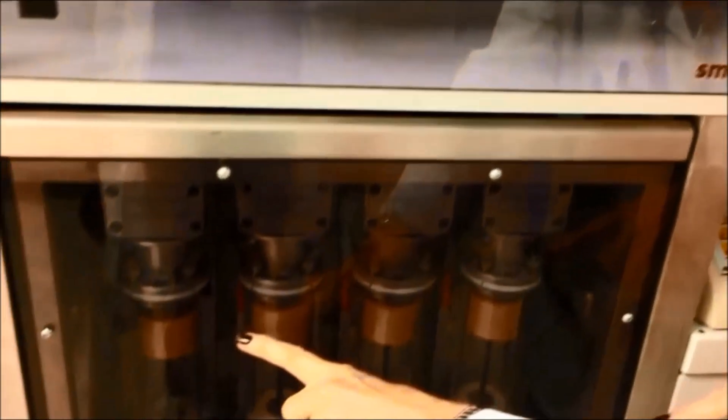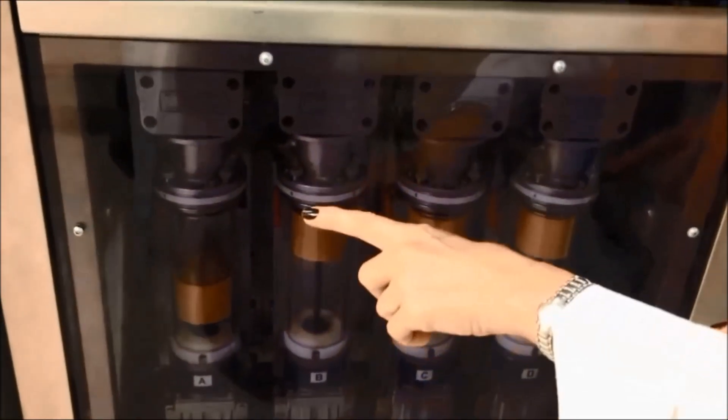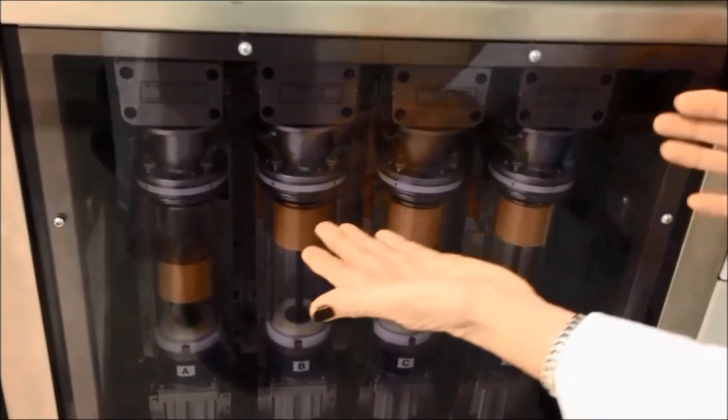The cigarette is being lit. The smoke is starting to go up, but you can see that the piston is going up and down now. It's sucking in the smoke, it's making the appropriate dilution.